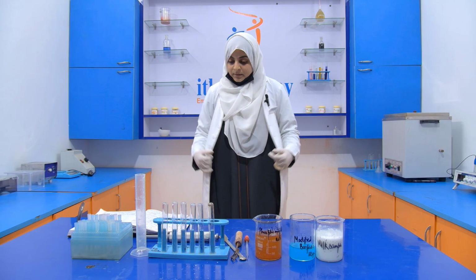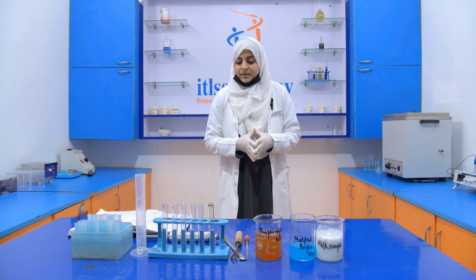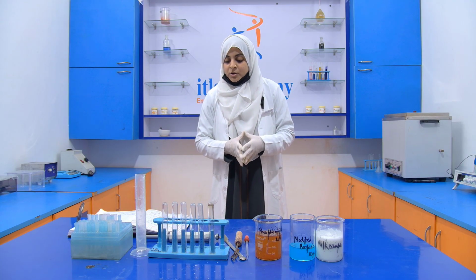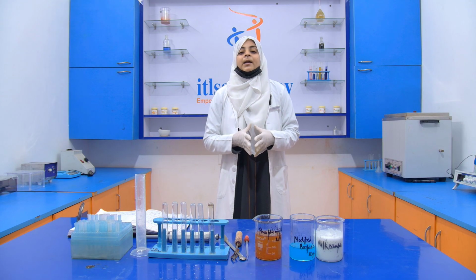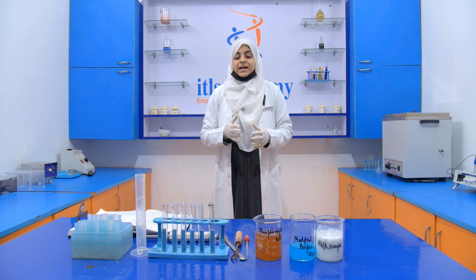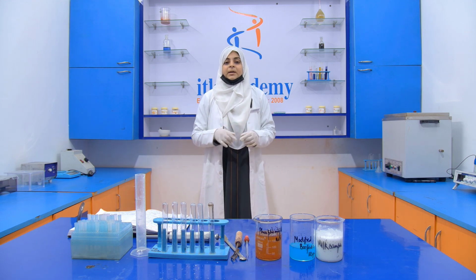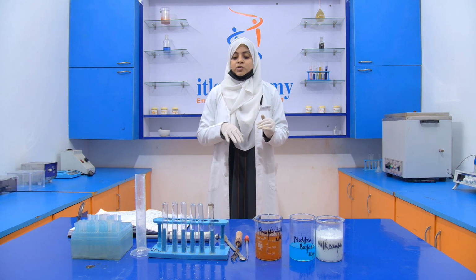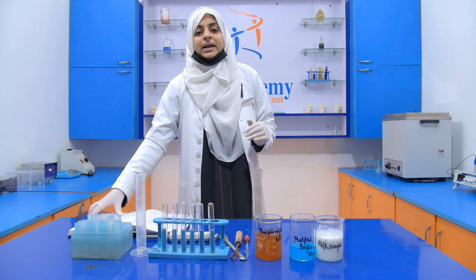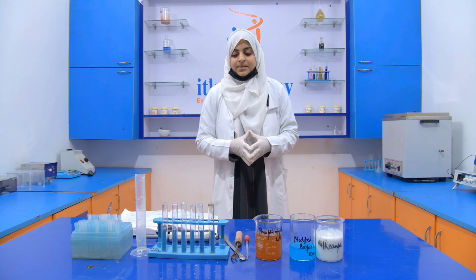Okay, so we require 35 gram of ammonium molybdate, 5 gram of sodium tungstate, 200 ml of 10% sodium hydroxide and 200 ml of distilled water. Now when we dissolve it completely, then we boil it for around 20 to 40 minutes, sorry, 20 to 60 minutes.